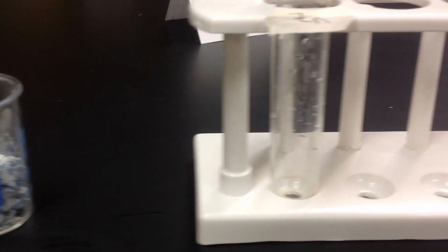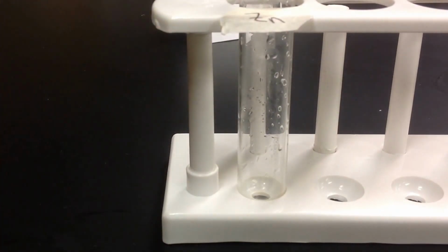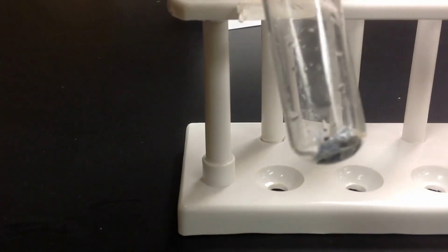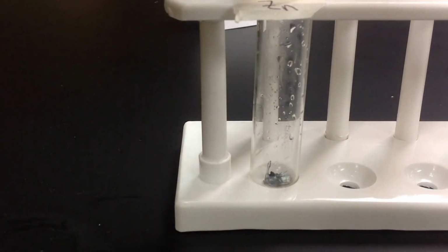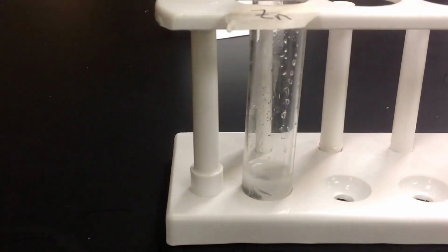Okay. And we're going to go to the third one. This one you guys should be able to see a little bit better. So for this first one, I'm going to take a piece of zinc. So there's zinc metal. Let's take a good chunk here. And you can see what that looks like. It looks kind of whitish, silvery. And then I'm going to take a little bit of hydrochloric acid, and this is pretty strong stuff here. So you can see what that looked like before, just a clear liquid.